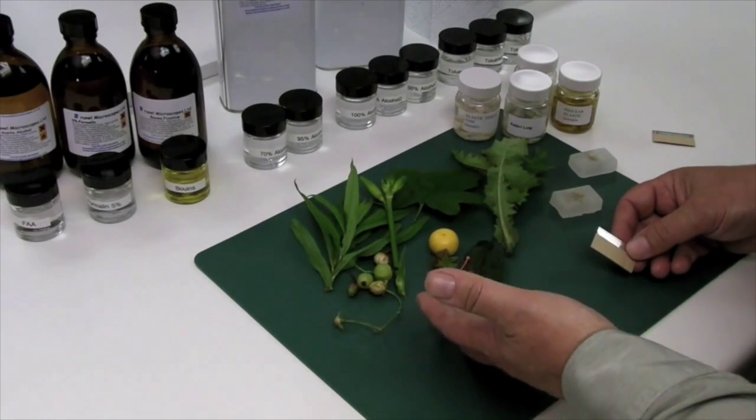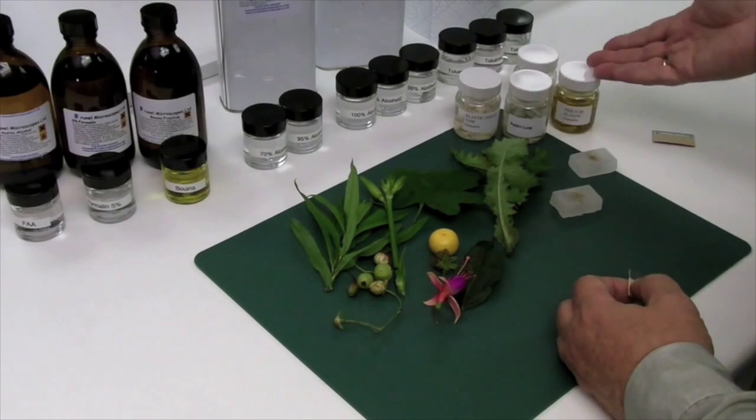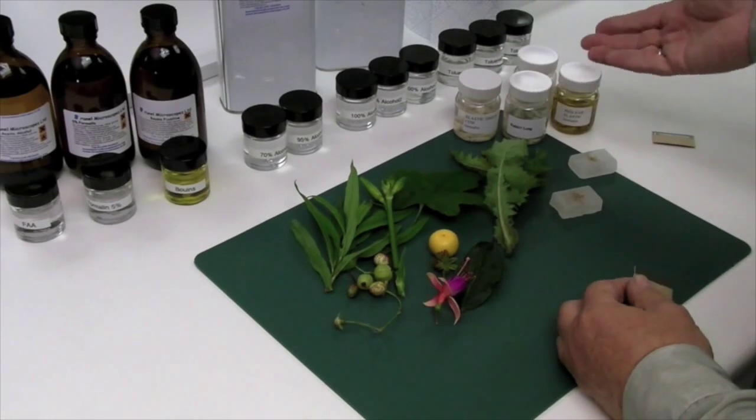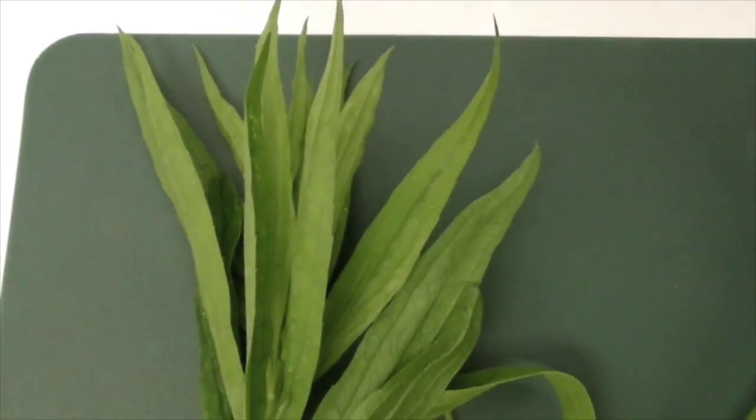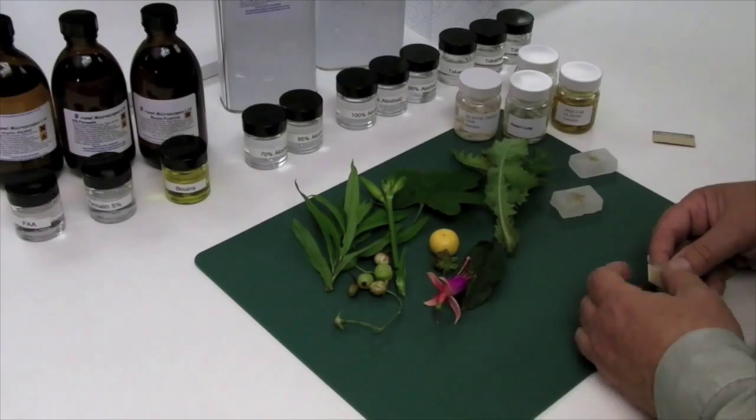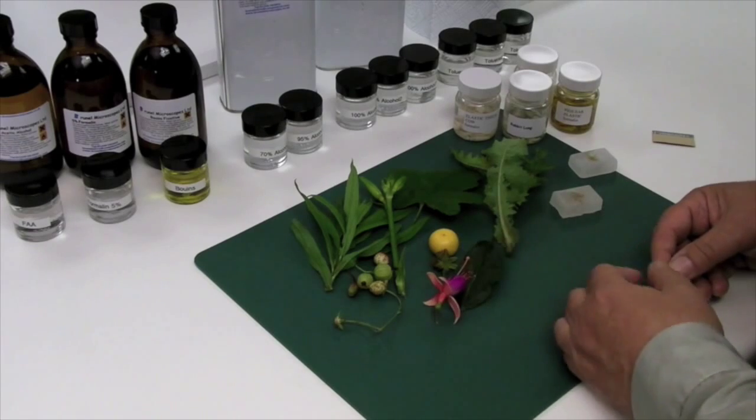Once selected, the material has to be preserved by fixation, and we will deal with the choice of fixative later. Here we have a variety of botanical specimens and some previously fixed animal tissues.